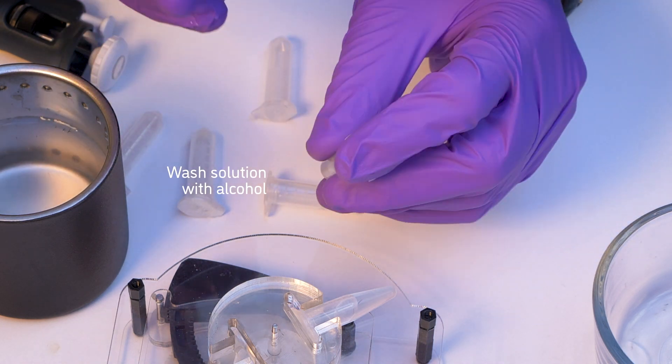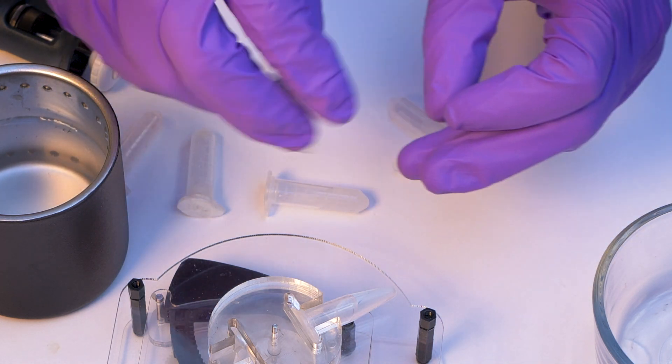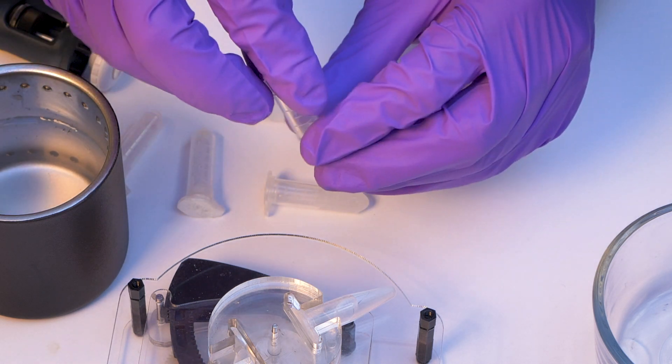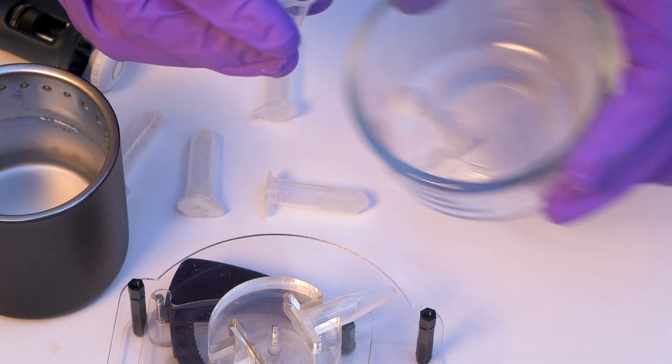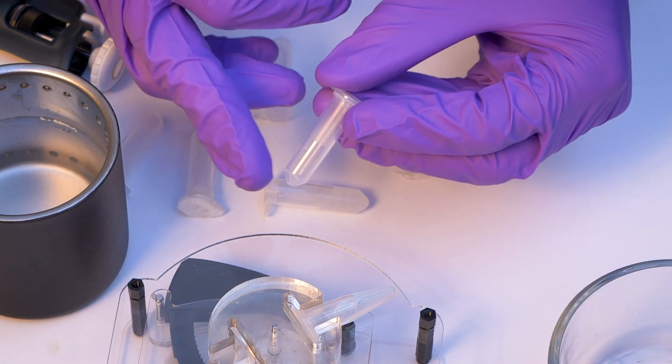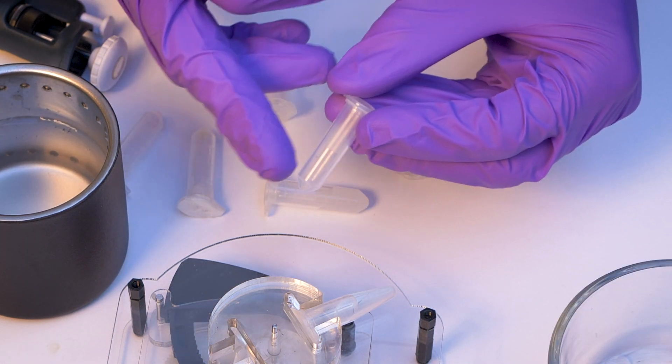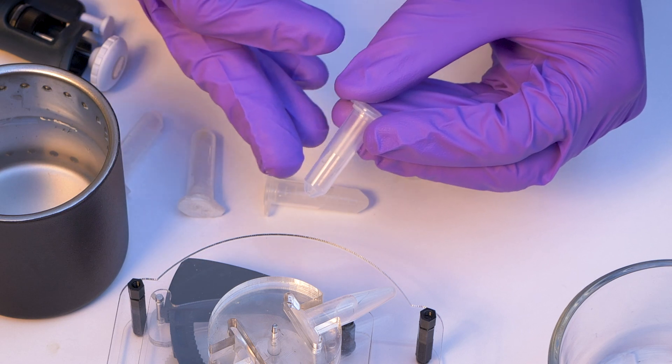So what we can do now is wash this with alcohol. And so now the viral RNA, if present, is stuck to these beads, and it's super stable. So what we can do is either store this or directly go to the reaction.